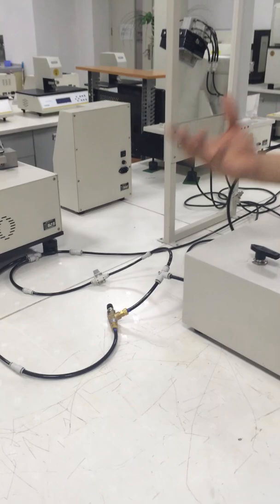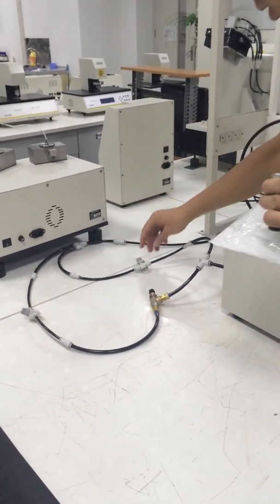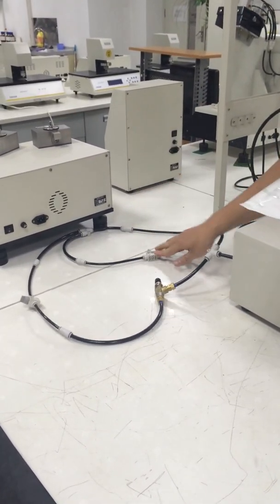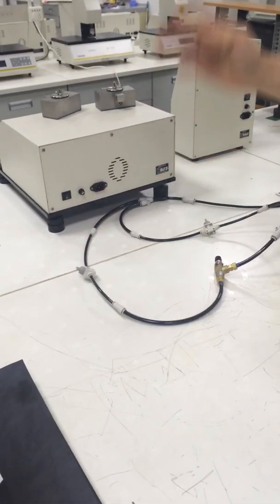If we want to perform a bubble test, we make the flow rate smaller. So we close this one, open this one, and the flux will be smaller.